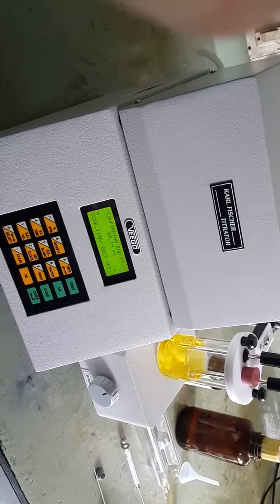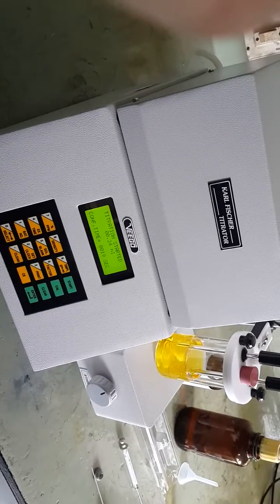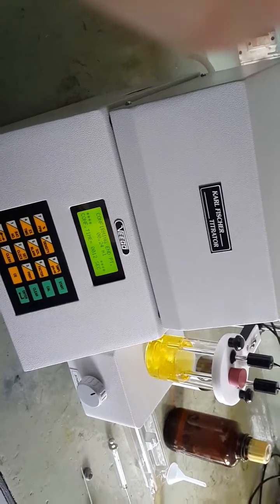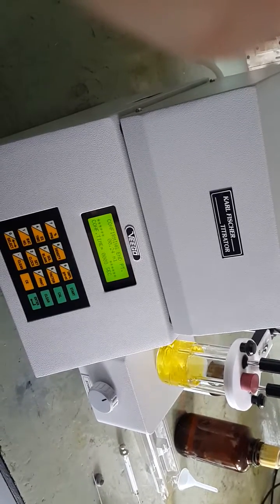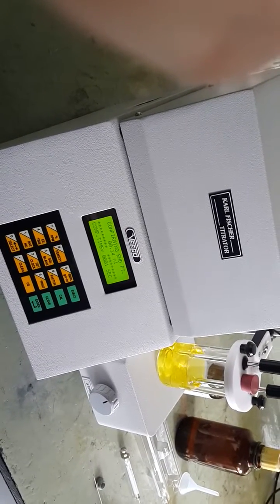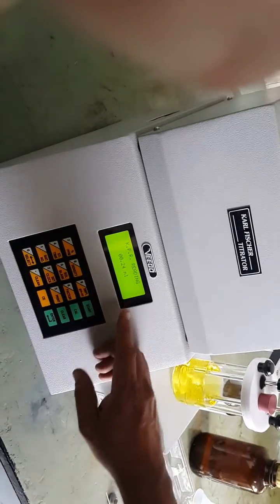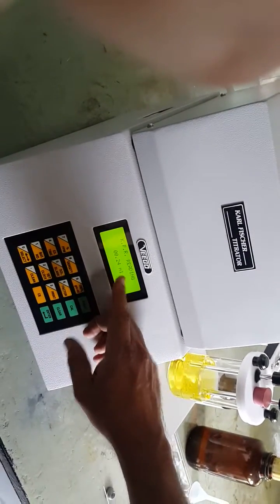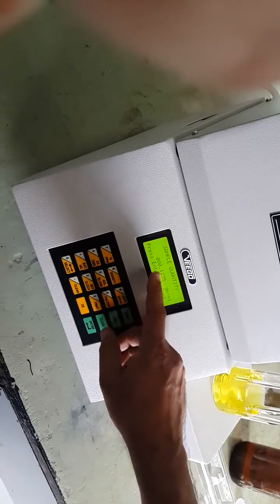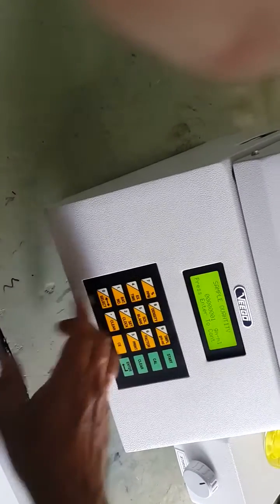Some water is detected — excess water signal is on — showing 0.19 ml, then 0.24 ml of reagent. It waits 20 seconds for confirmation: 4, 3, 2, 1, 0 — this is the endpoint. To neutralize 10 ml of methanol it took 0.24 ml of reagent. Press the sample quantity key; last time we had 0.1235 grams, but now the sample quantity is 10 ml, so enter 10 and press enter.